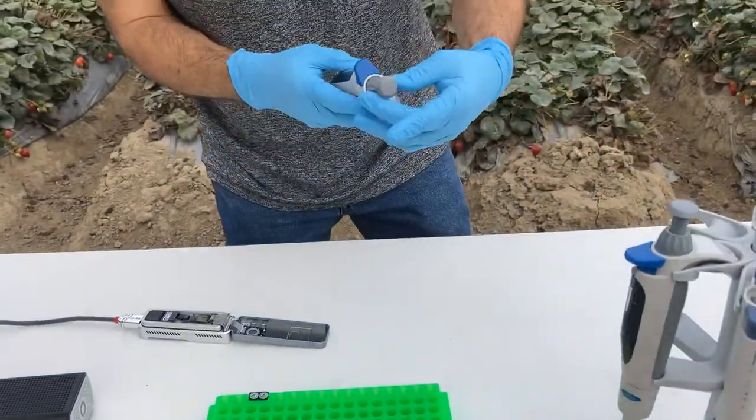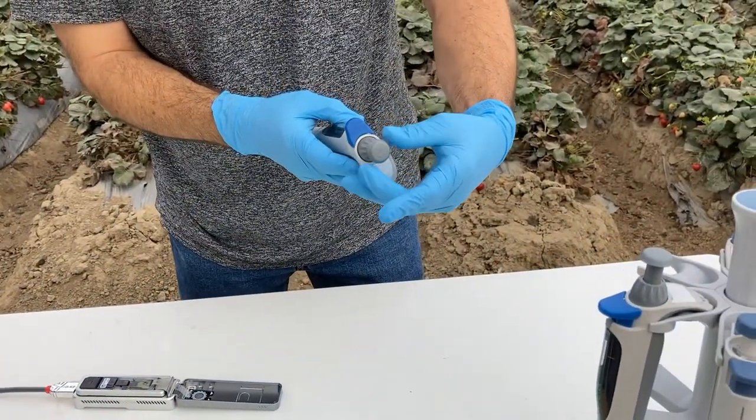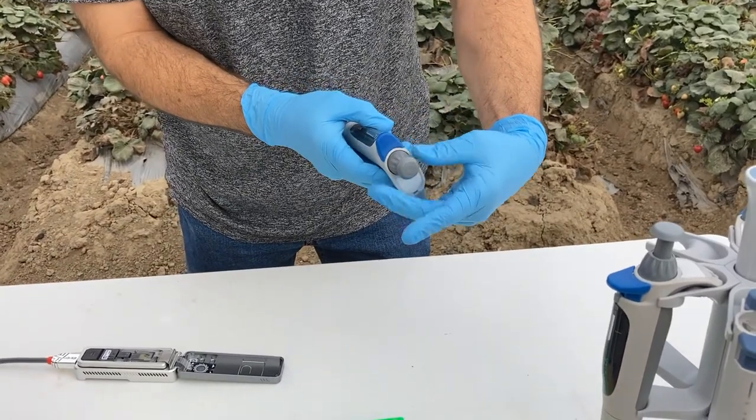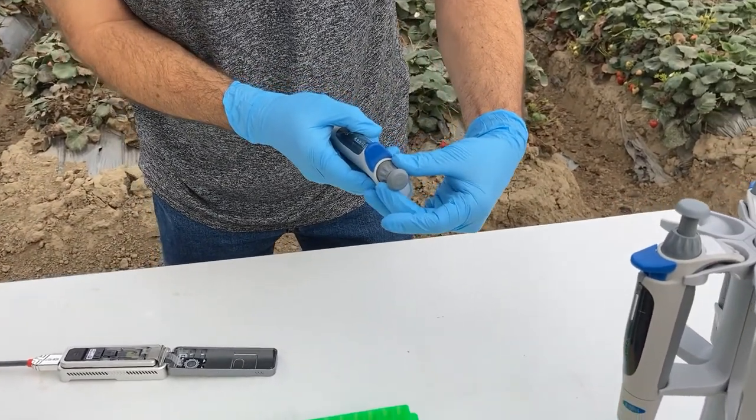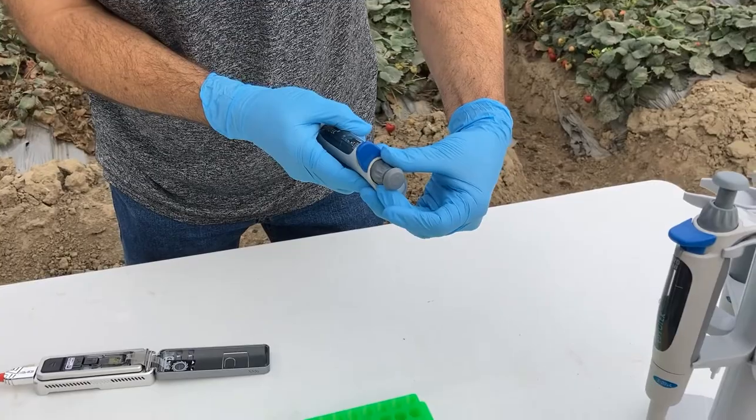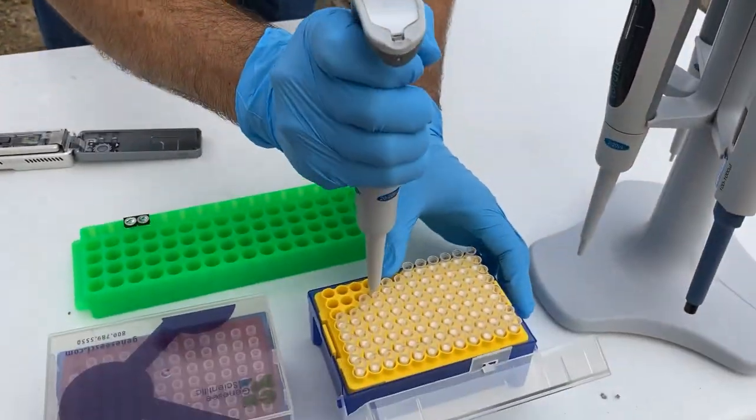And the next thing we're going to do now is load our sample. So I'm going to bring this down to 30 microliters. I'll call it a little 31 because I'm going to stop just a little short there.